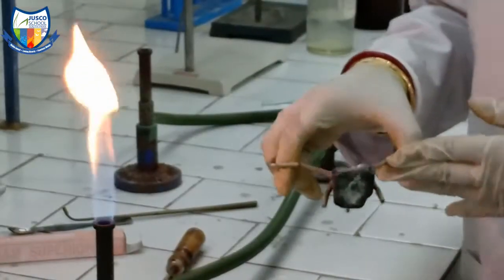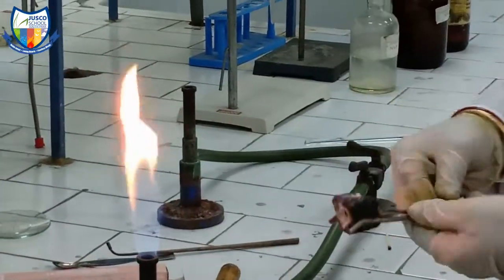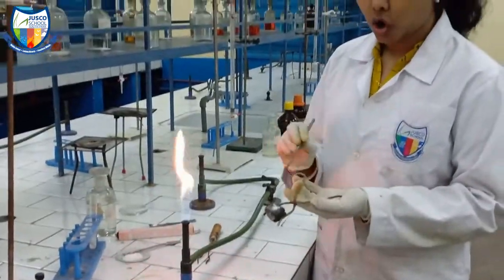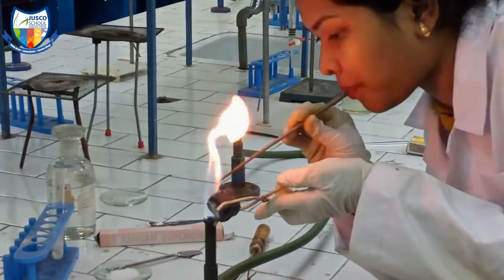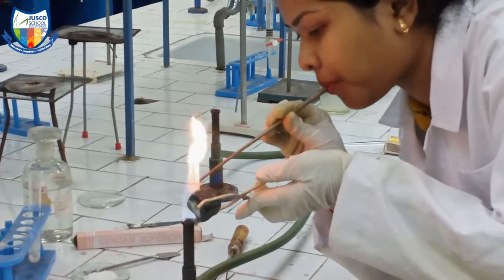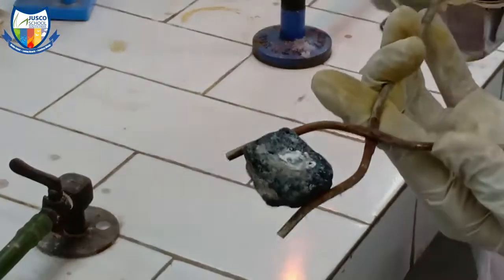Next, we will take the charcoal cavity and place a small amount of salt in it. With the help of a blower, we will blow and observe whether the colour of the salt changes. As you can see, the salt has solidified and there is no change in colour.